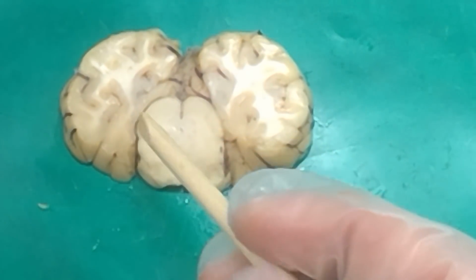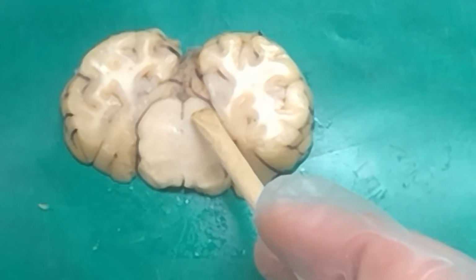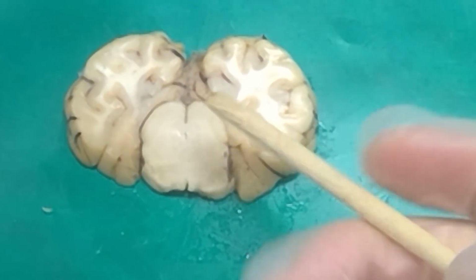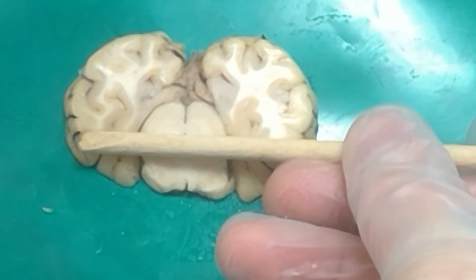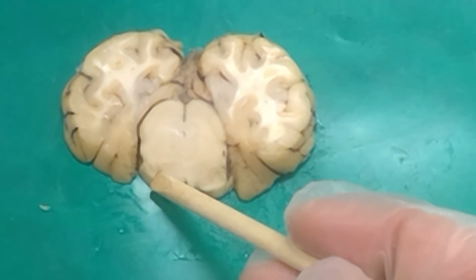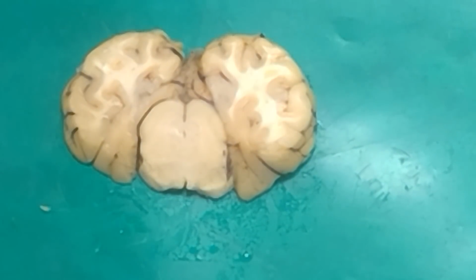All right, so what is this nucleus right here at the top? Superior colliculus, and this little hole right here. And so then everything that is the cerebral aqueduct, everything that is above that hole is considered the tectum, and everything that's below the hole, the tegmentum, correct. And so therefore these guys that are the bumps here at the bottom, correct, those are the cerebral peduncles. I think that's everything off of our coronal structures list.